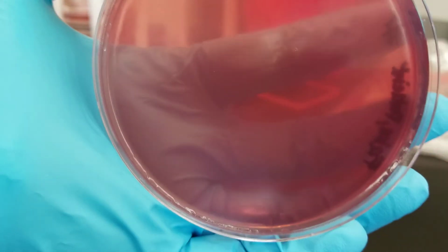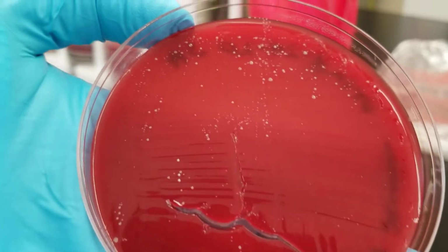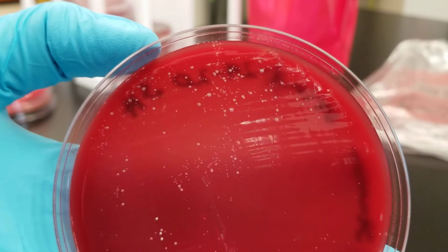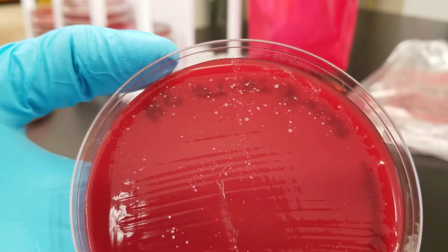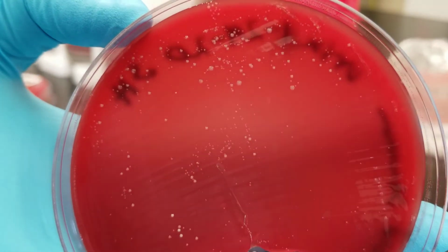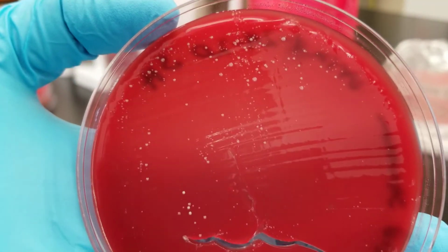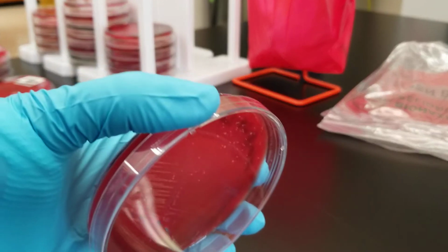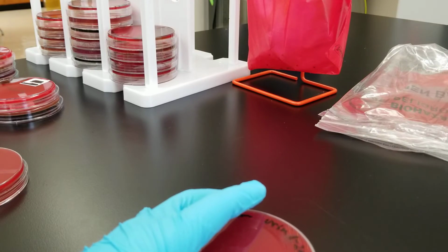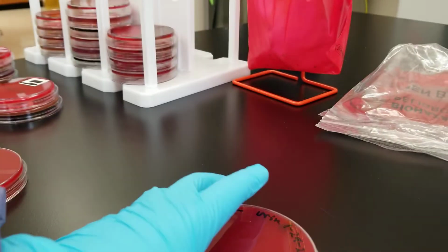And nothing on the MacConkey plate. So the most common pathogens, it doesn't look like they're here. Again, depending on what the gram stain showed, you might end up working something up. But there's a couple of different types of organisms on here that is usually considered to be a non-clean catch specimen. So this person, if it had been an actual patient, didn't actually do a clean catch urine. And that's why there would be the skin normal flora. So this would be considered a contamination.